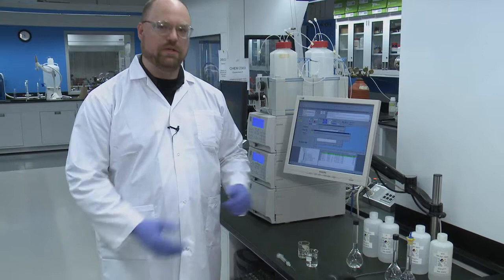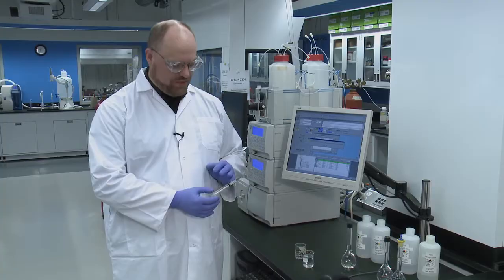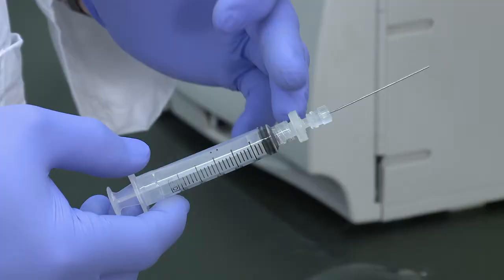Once you have all your solutions made that you're going to need to analyze, the first thing that you're going to want to do is work with the syringe.